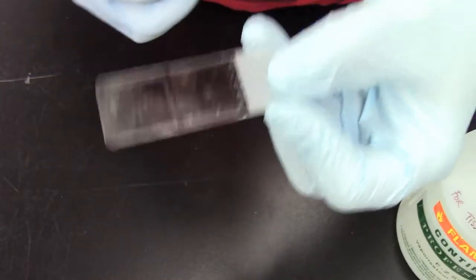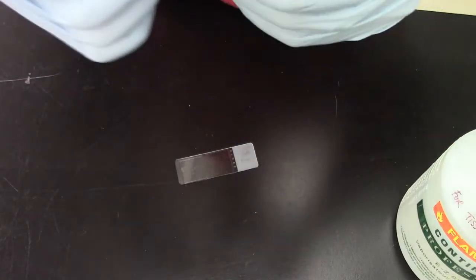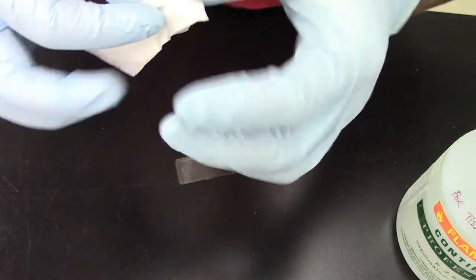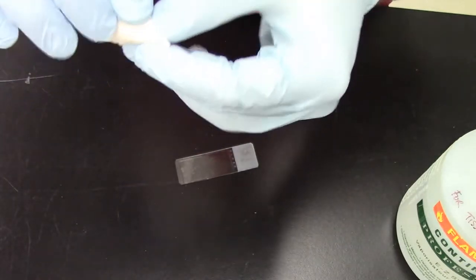Okay, so this was one pass. You take your kimwipe and you kind of re-fold it so you expose a different clean section of the kimwipe.